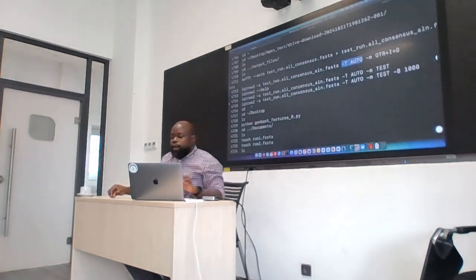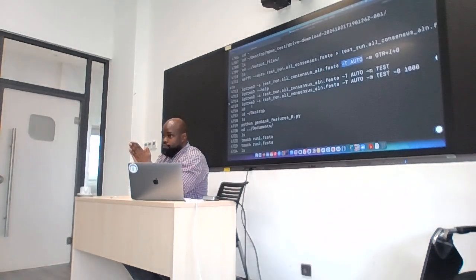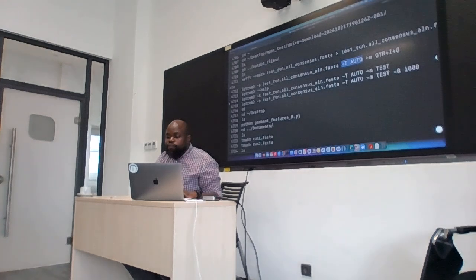Okay. Now, when it comes to the models, you can either use a specific model, and the option for models is -m.